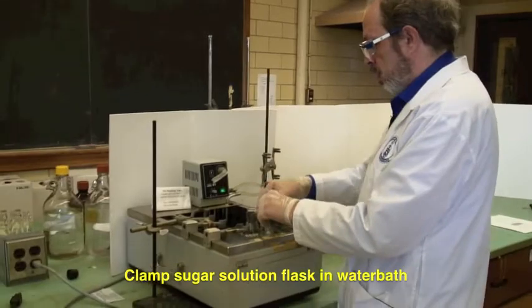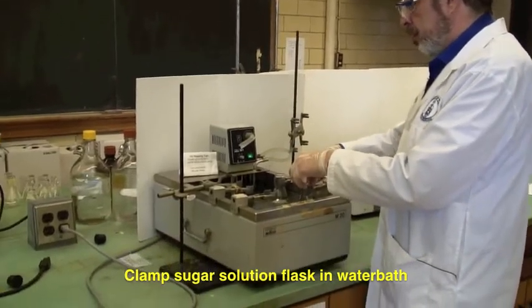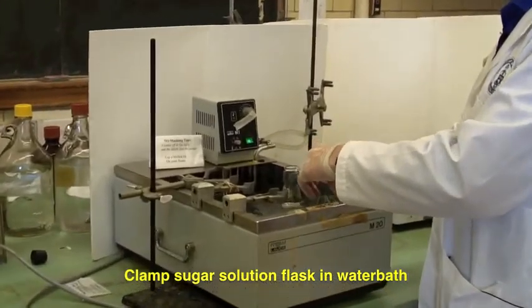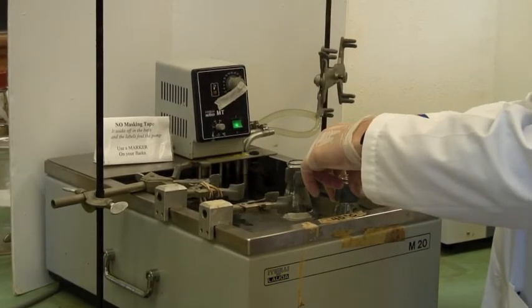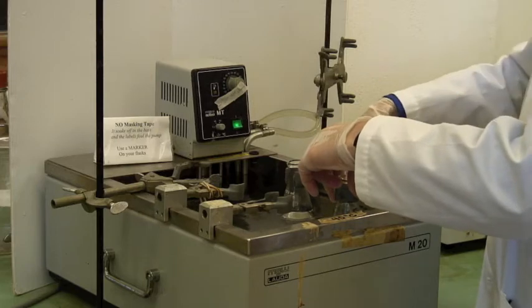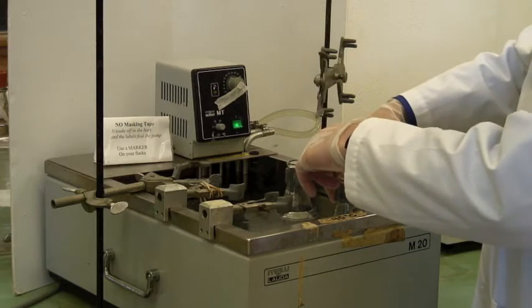And place this also in the hot water bath. And we let this sit for about ten minutes to make sure that it gets to the appropriate temperature.